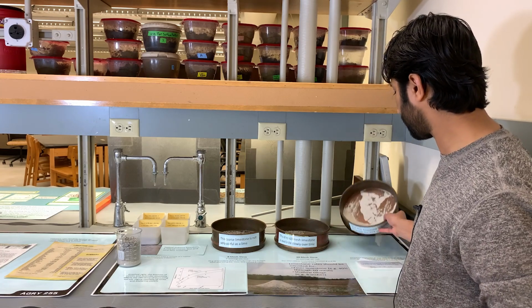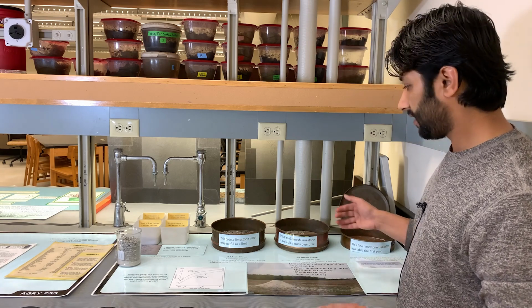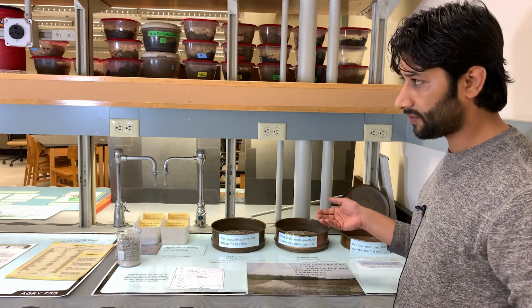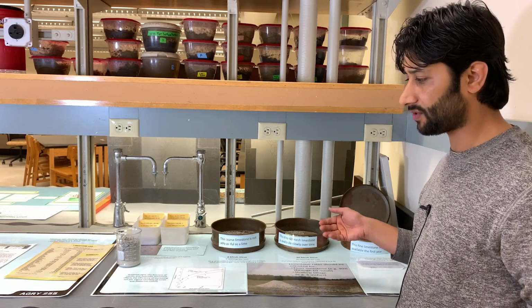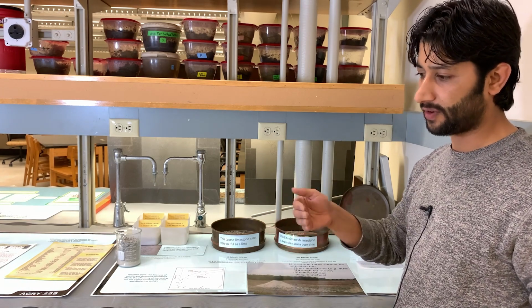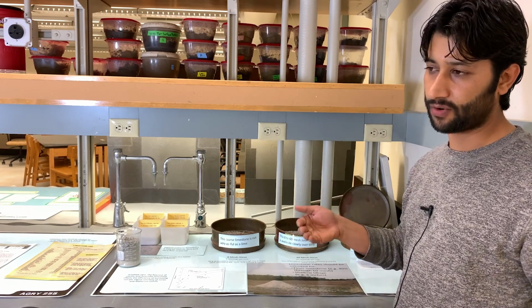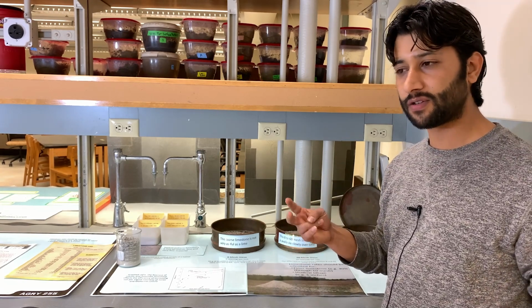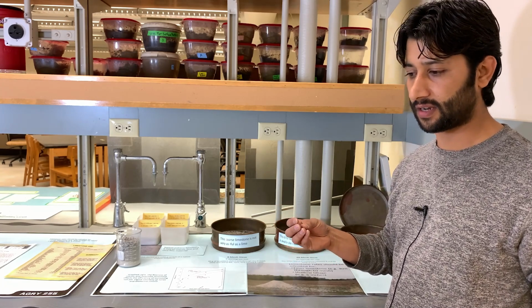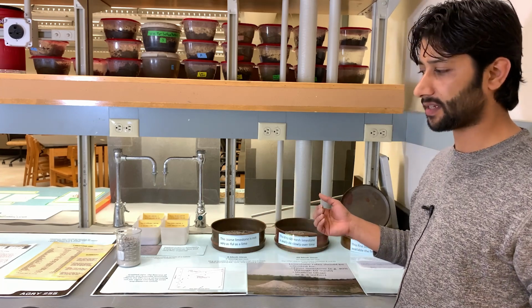So 314 went through this. This will be the 314 grams that we have. So 314 divided by 1,000 times 100 will be 31.4%. So we met the second criterion also, which is the 25% limit for 60 mesh, and we have right now 31.4%. Based on those two criteria, we met the criteria for the Indiana satisfactory level. So yes, we can apply this lime.